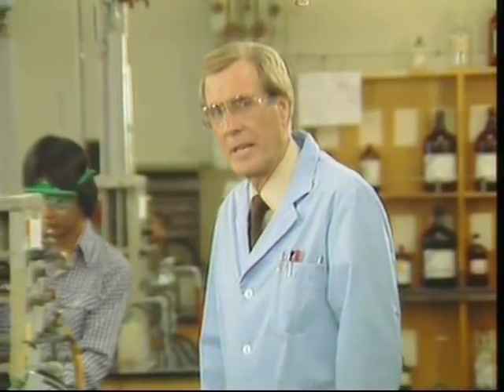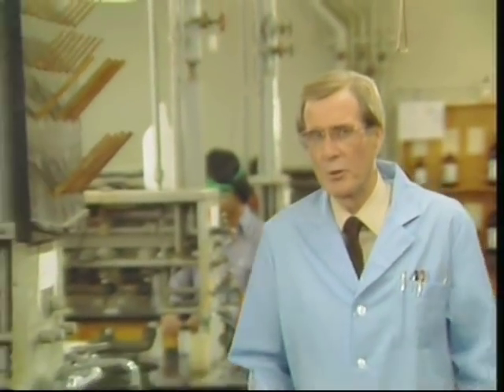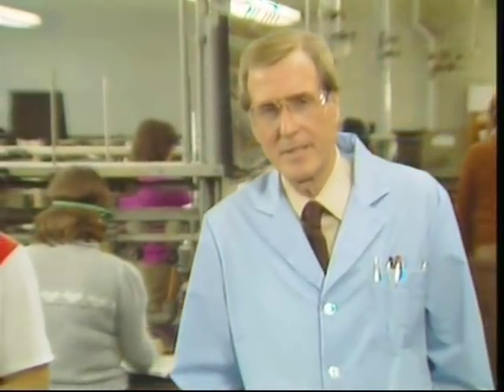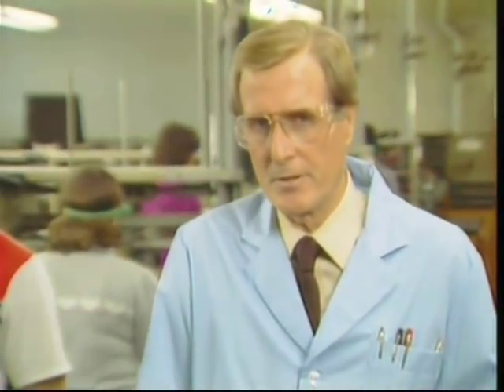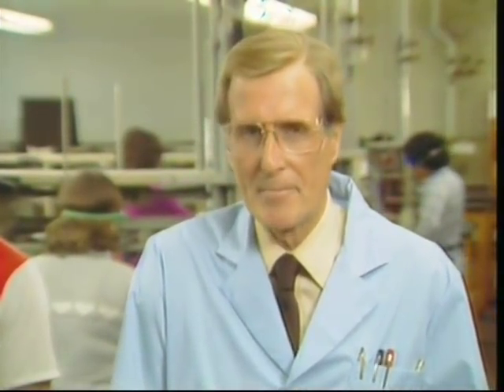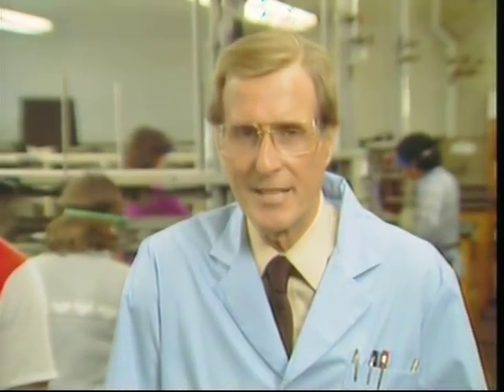Your chemistry lab can be one of the safest places you can work in, certainly safer than your home. But this can only happen if you and everyone in your lab develops and practices safety consciousness. If you understand that your safety in the lab demands your constant vigilance, your chances of serious accidents and severe injury are minimized. I've tried to give you some general guidelines for safety in a lab. I know that I've covered a lot of material quickly, so let's review the concepts.